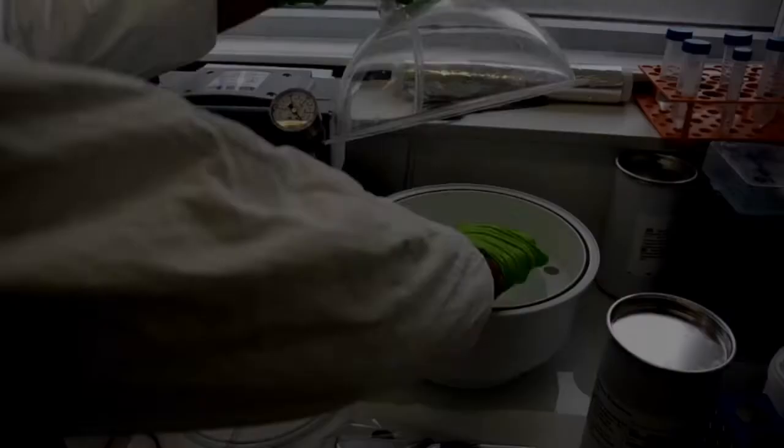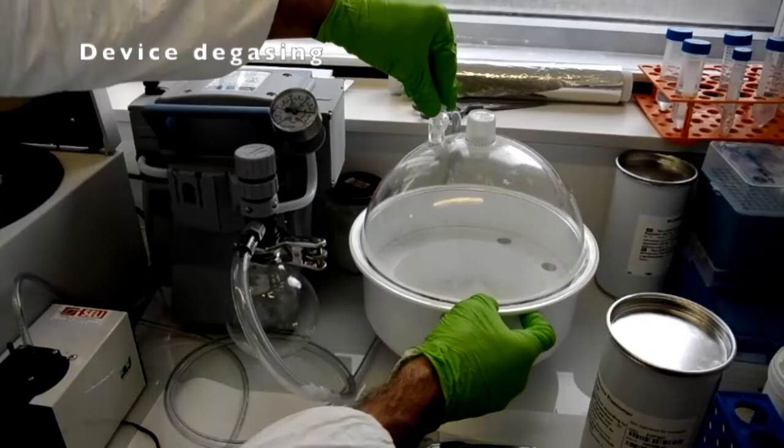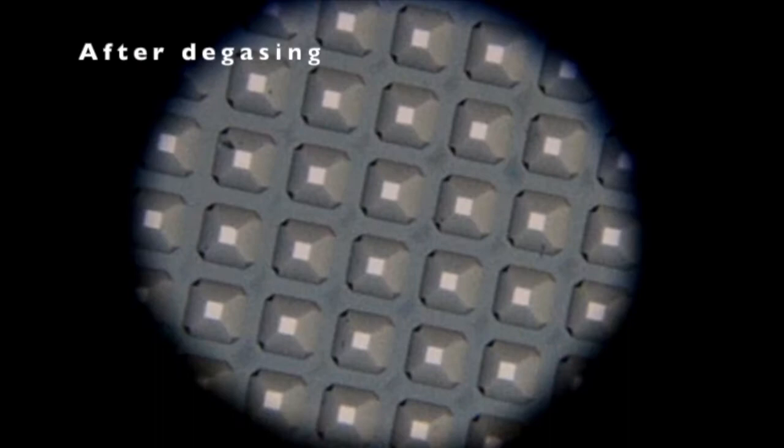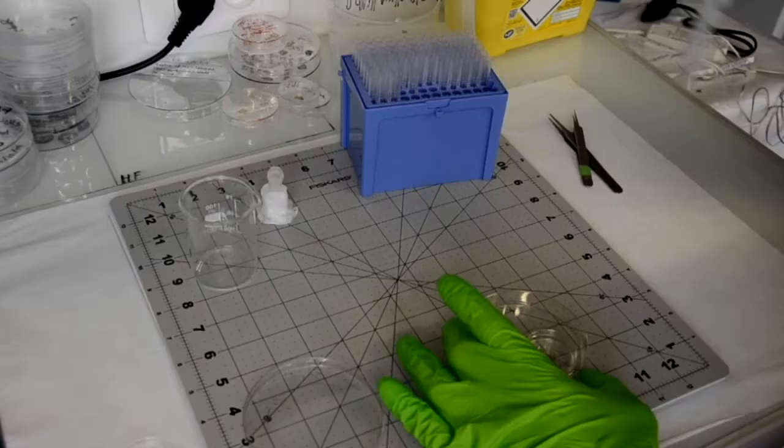We then pour ethanol onto the device for two objectives: first, to clean and sterilize it — it can also be combined with a UV illumination step for further sterilization; and second, to allow us removing any bubbles that may be trapped into the wells by placing the sample into a vacuum chamber. Once degassed, the device looks like this, where we no longer see any bubbles trapped into the wells as compared to before.